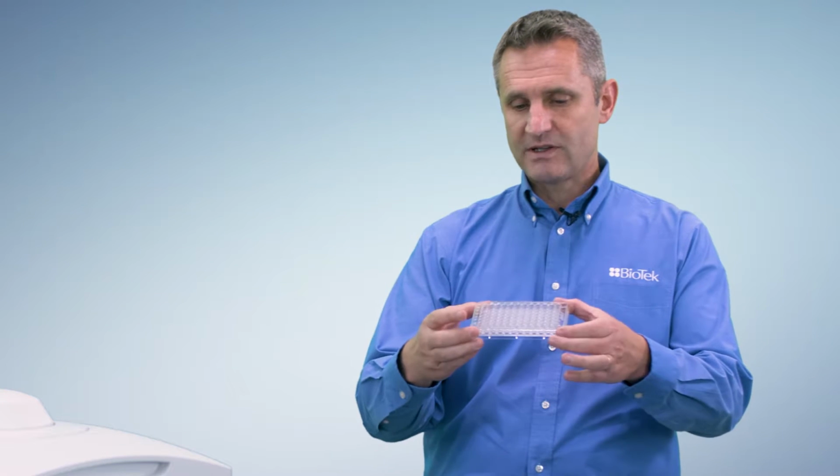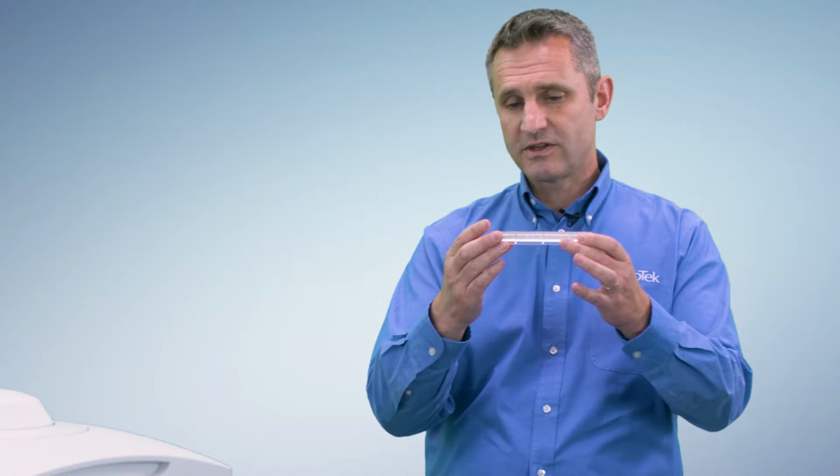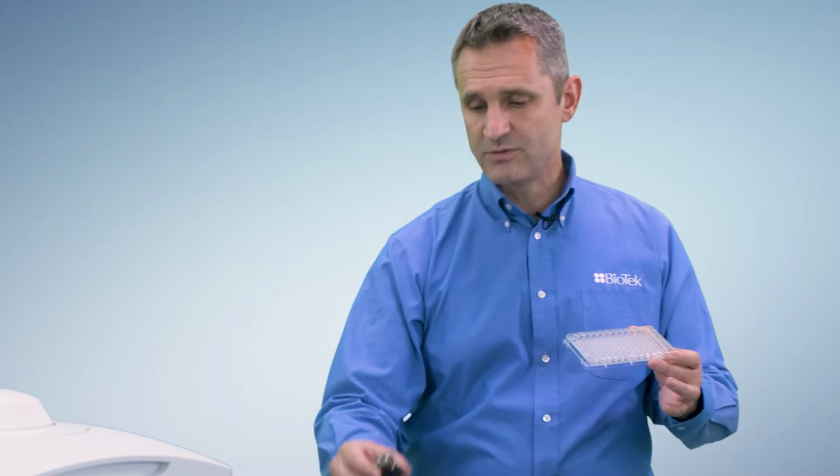When the system automatically tries to image cells at the bottom of your wells, the hardest thing for the machine to do is to actually, with the objective, find where your cells are located, because the focal plane is very small. And what you want to define, the most important thing, is exactly the location of your cells in your sample vessel. So your objective will be located close to the correct position. What this will do for you is, if you define this properly, the system will autofocus faster, and your success in autofocus will be higher.